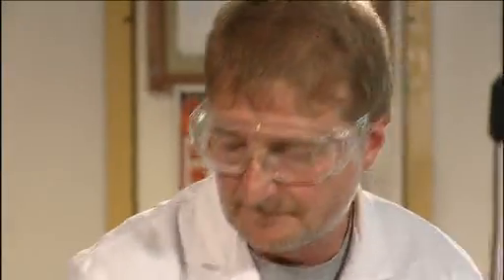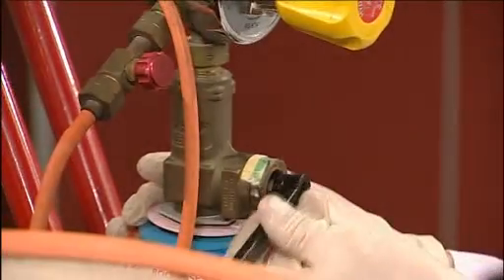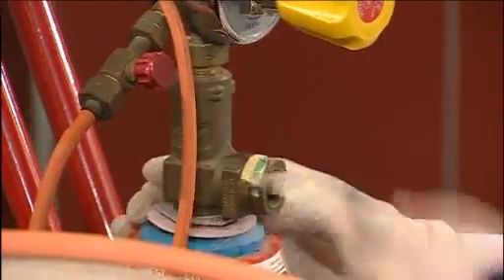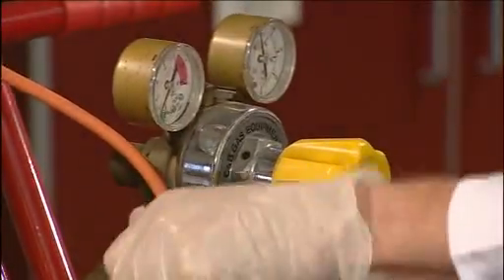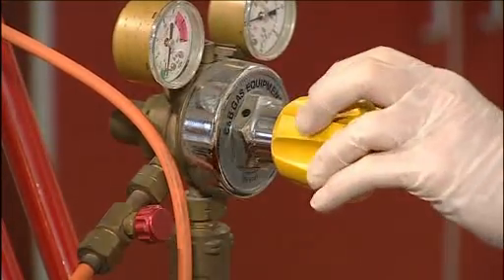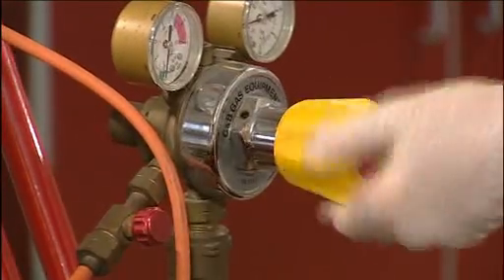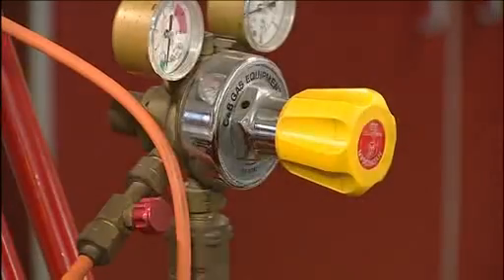Finally, we have to turn off the hydrogen cylinder. Here, we first close the cylinder valve with the spanner. And we then need to use the pressure reduction valve. We turn it on and the needle valve on to vent any hydrogen from the valve gear. Finally, turn off the pressure reduction valve and also the needle valve.